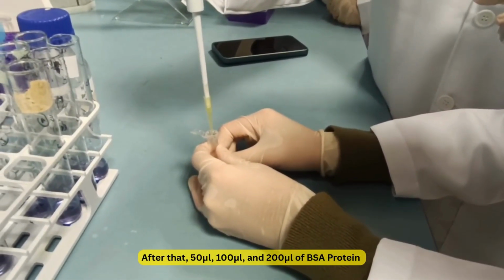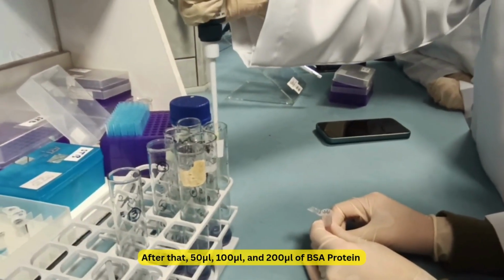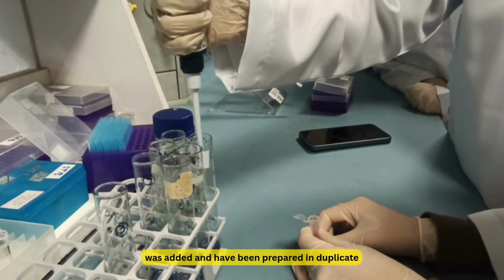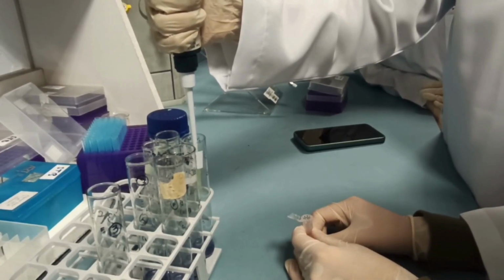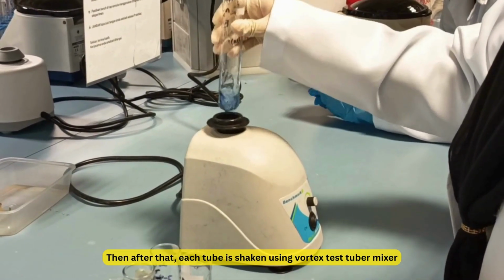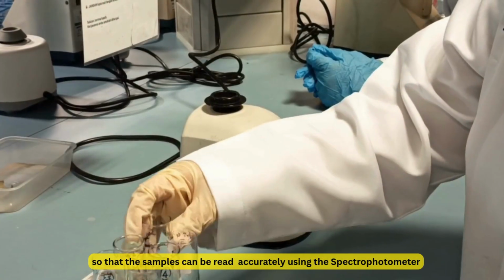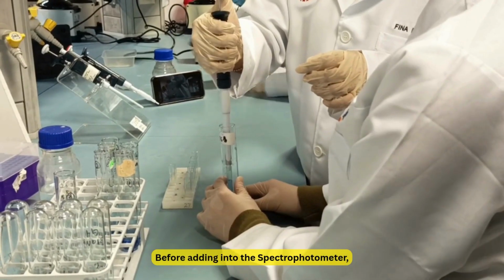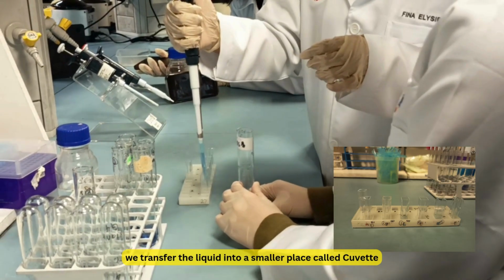After that, 50 microliters, 100 microliters, and 200 microliters of BSA protein were added and prepared in duplicate. Then, each tube is shaken using a vortex test tube mixer, so that the samples can be read accurately using the spectrophotometer. Before adding into the spectrophotometer, we transfer the liquid into a smaller container called a cuvette.